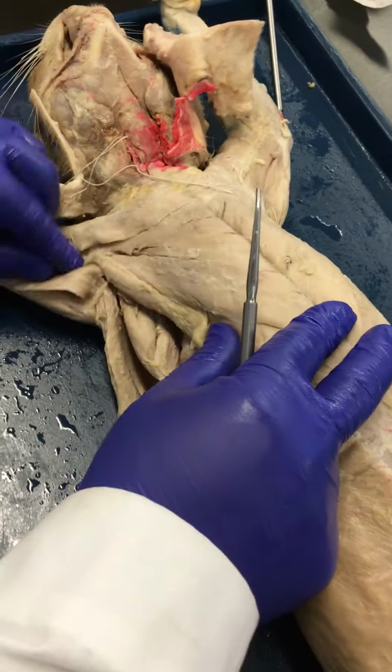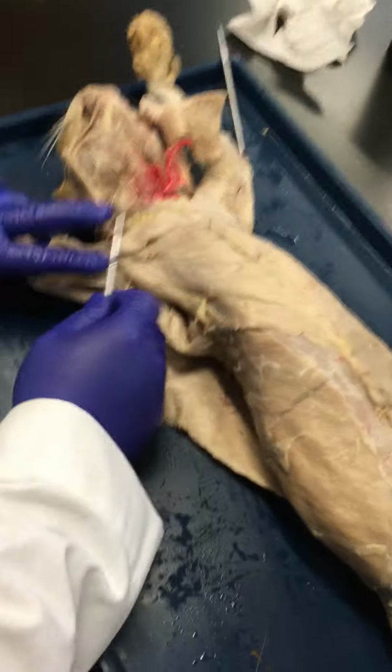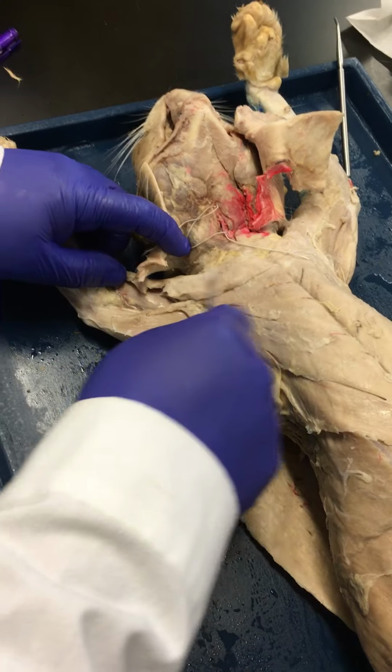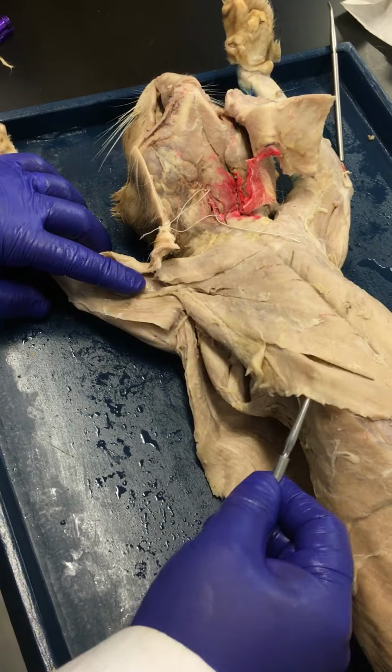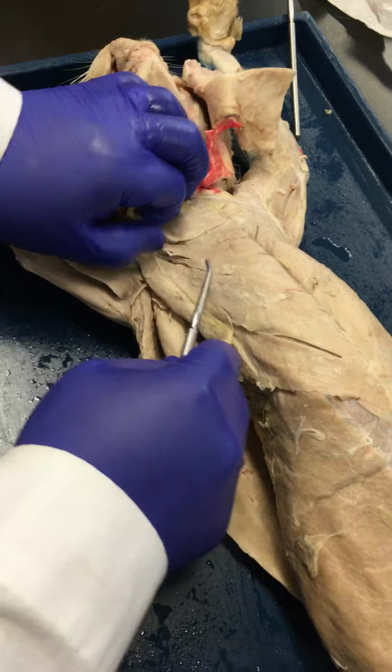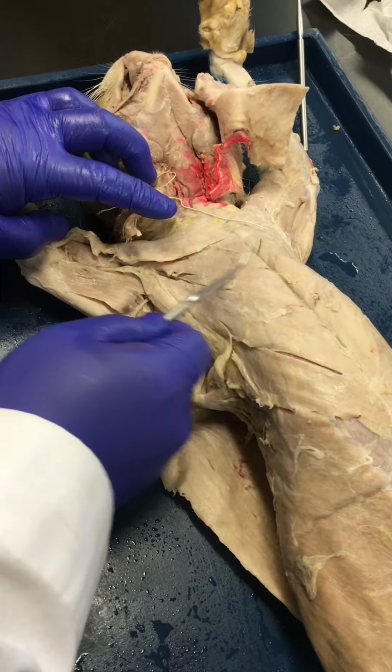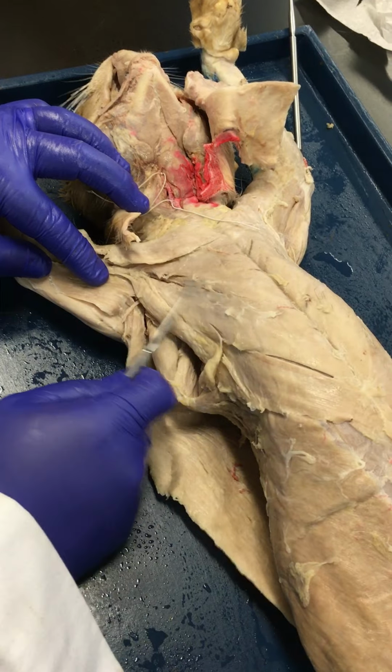If we move down to the chest, this is where you had your two landmark muscles that are cat specific that we're just going to name: the pecto antebrachialis and the xiphohumeralis. The muscles we're interested in are between them, right? And so here are your two landmarks. Here's your pectoralis major and the pectoralis minor.